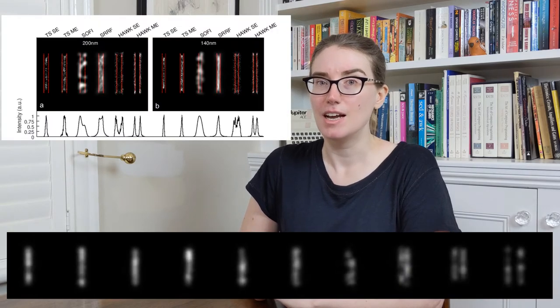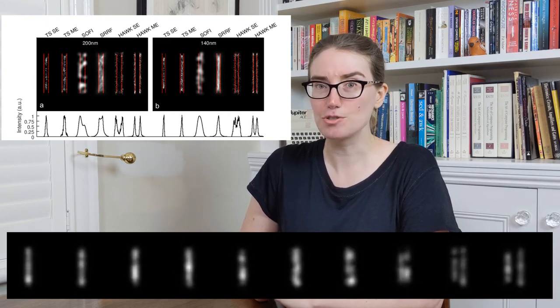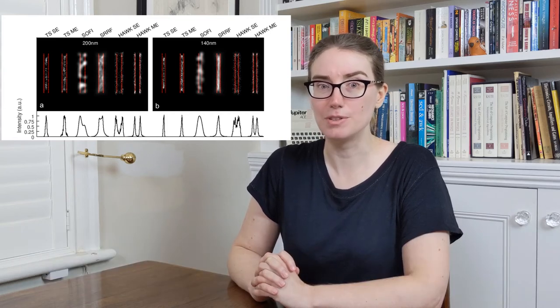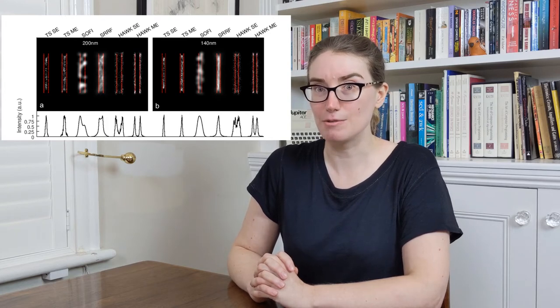options. As you can see, using other analysis methods, the two lines tend to collapse into one another or exhibit a lot of structure in the space between the lines that doesn't actually exist. I'd emphasize the methods we've chosen here are a sample. In our tests, we found these effects happen with all the methods we've tested, though as the quality of fit improves, the methods can return accurate results at higher activation density.